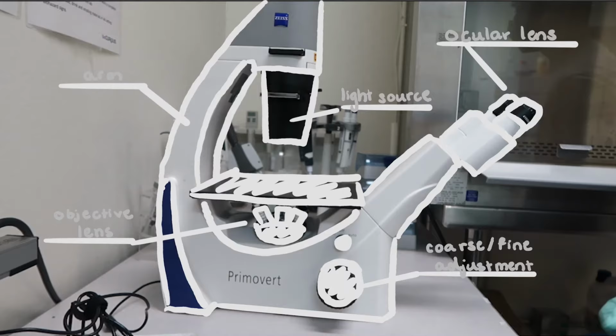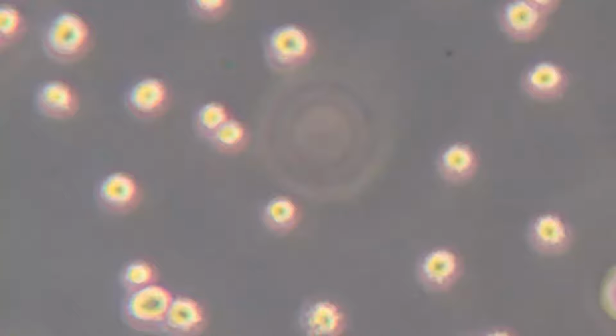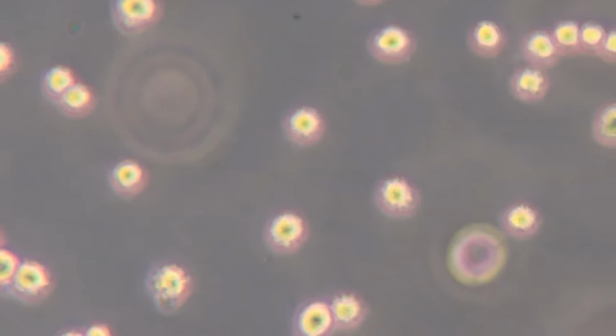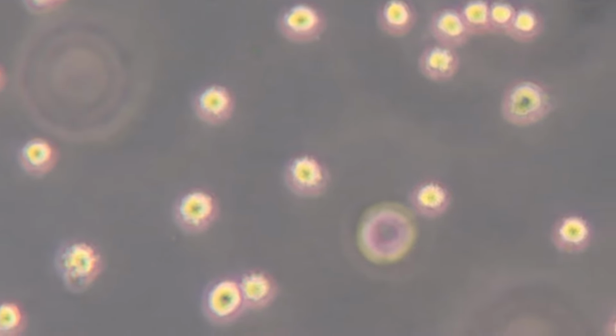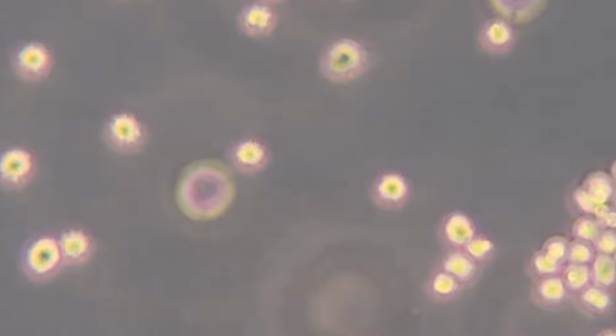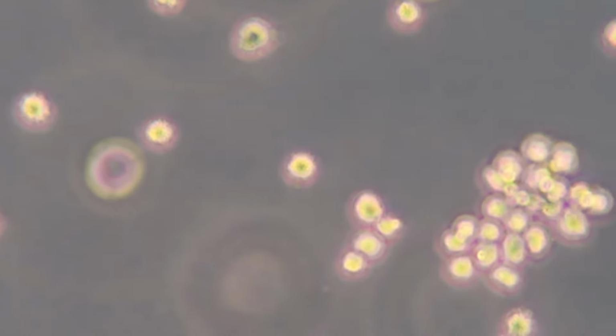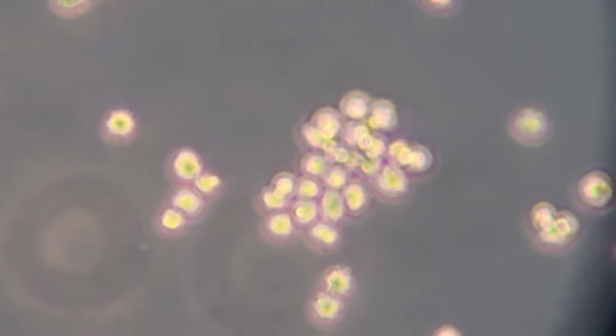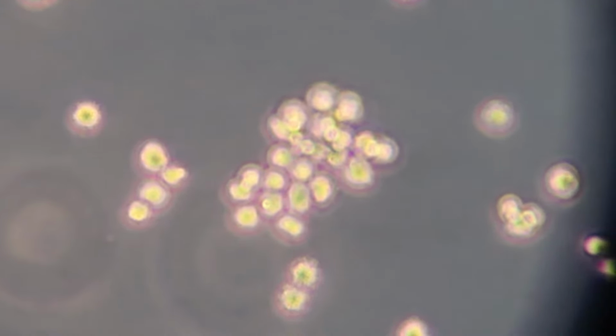The light microscope is commonly used to see organisms such as amoeba. We can see other types of protists, as well as bacteria, plant cells, and human cells. Sometimes through a light microscope, we are able to see certain organelles. Specifically in plants, we might be able to see chloroplasts or the main vacuole. And sometimes in animal cells, we may be able to spot the nucleus.